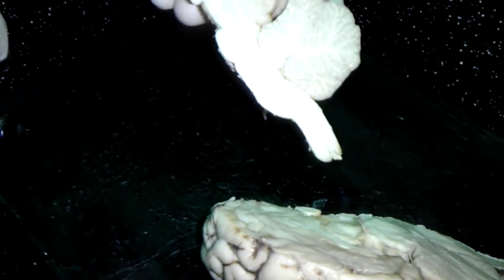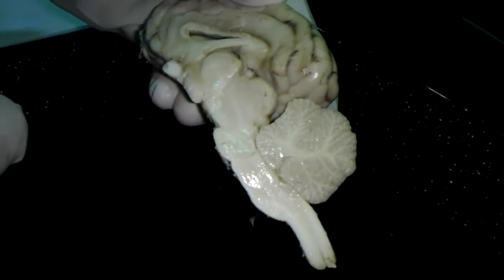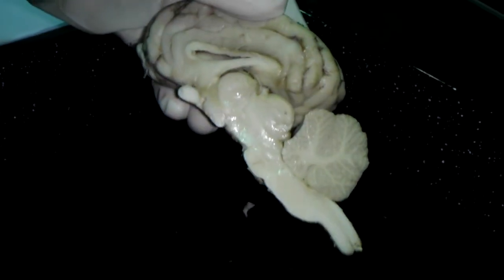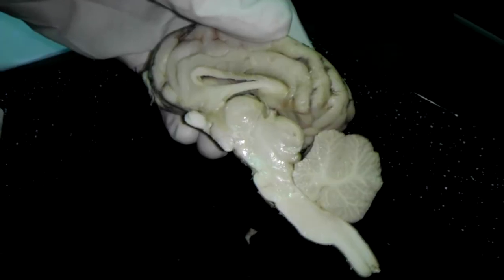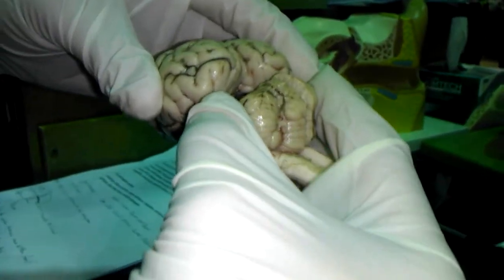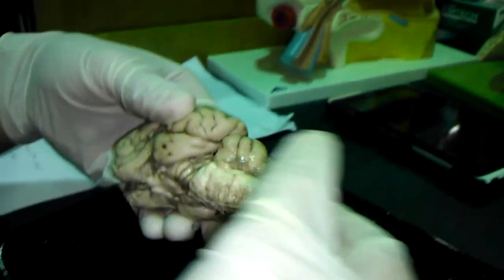Can you tell us which one is the corpus callosum from the lateral ventricle? The cavity in between here is the lateral ventricle, then all the way around it is the corpus callosum. Can you show the superior and inferior colliculi? That's the part we couldn't really show too well because we can't break this. It's in between the cerebellum and the cerebrum. Is it like two bumps? Yeah. The one on top is superior and the one below is inferior.